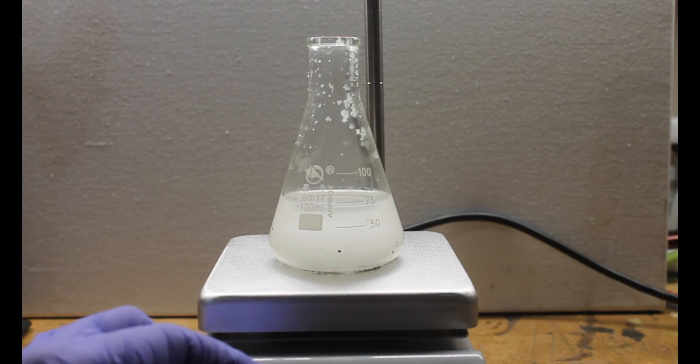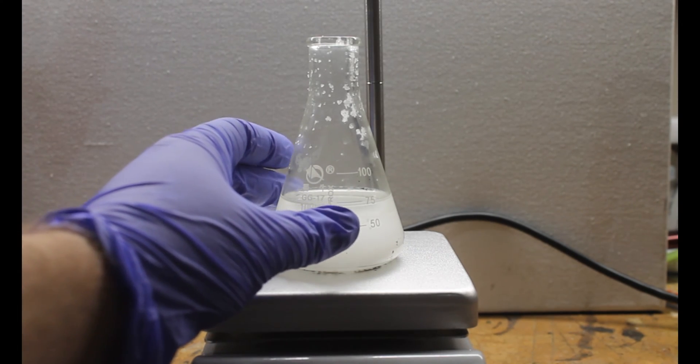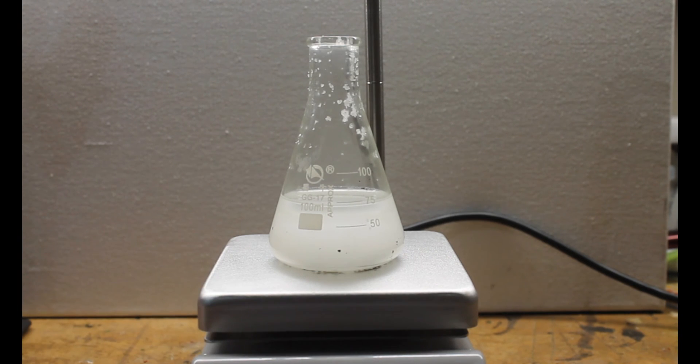We're then going to leave it to stir, mixing this in and allowing it to dissolve. This is very exothermic. A large amount of heat is being generated and it really wasn't long before our flask was actually too hot to comfortably touch.